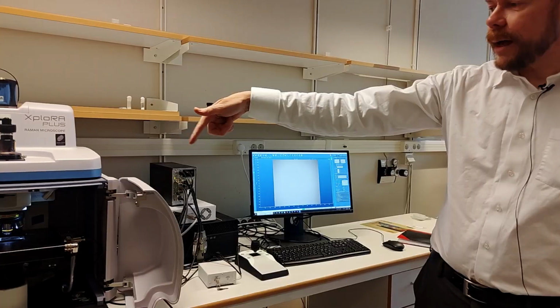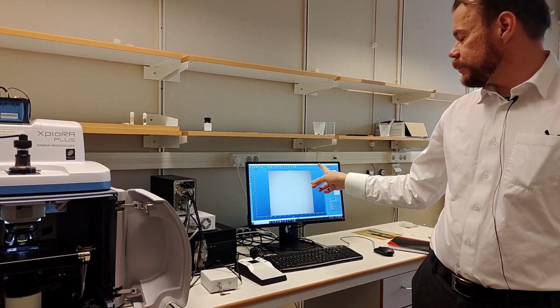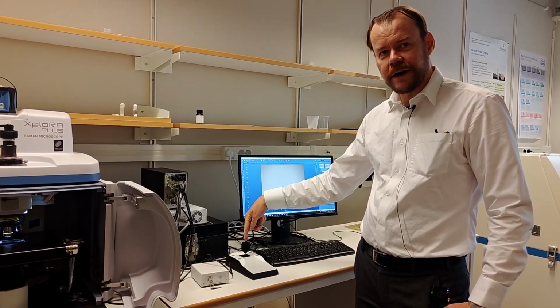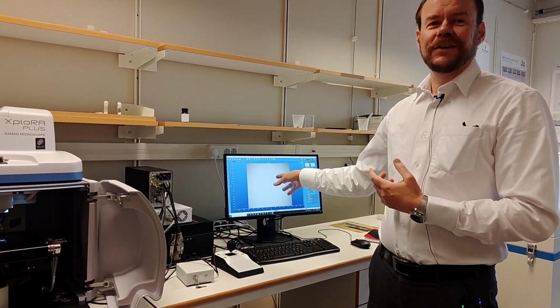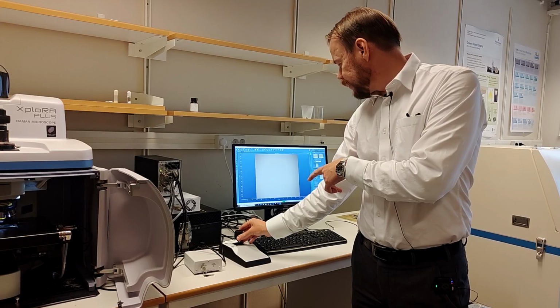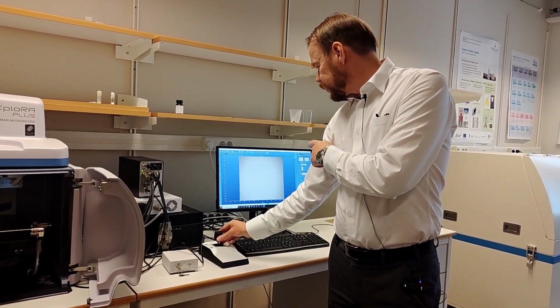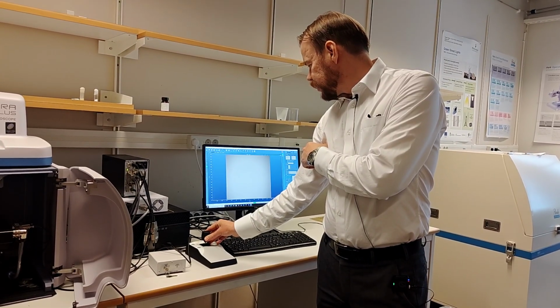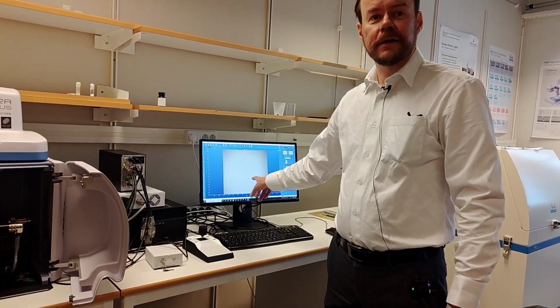And when you rotate up to higher and higher magnification, 99% of the time to reach correct focus is counterclockwise on the joystick. I say that because it's easy to get lost in the focus. So if I try to move counterclockwise, and I just turn very little, you don't want to go fast here. I look on the screen, and you see it comes into focus there. Now I see the dots again.